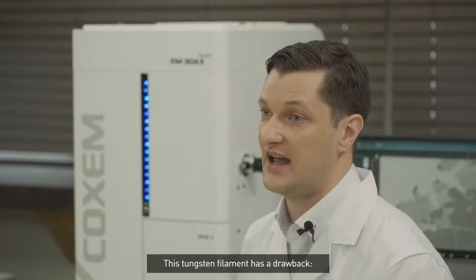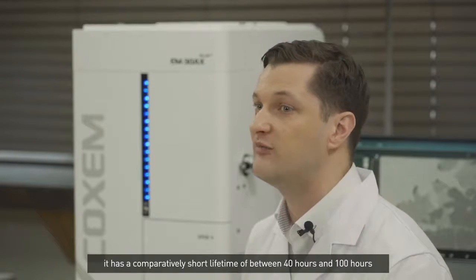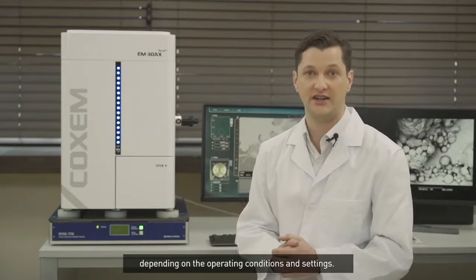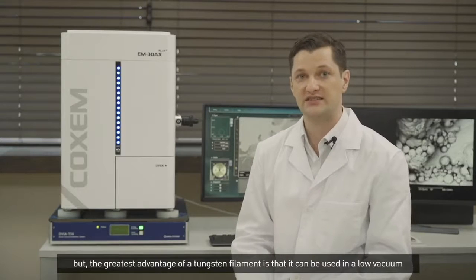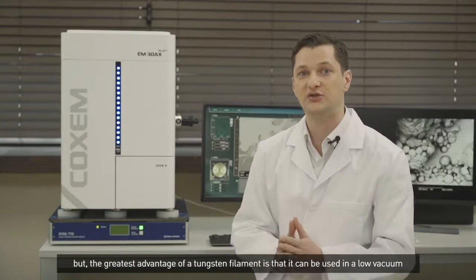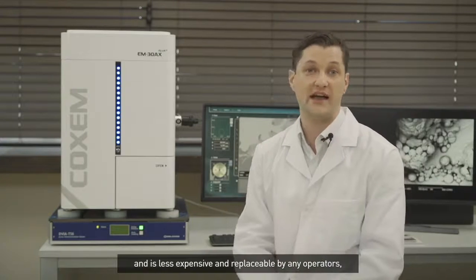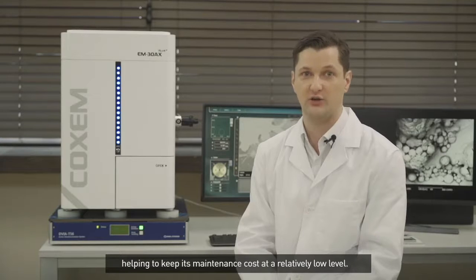This tungsten filament has a drawback. It has a comparatively short lifetime of between 40 hours and 100 hours, depending on the operating conditions and settings. But the great advantage of a tungsten filament is that it can be used in a low vacuum and is less expensive and replaceable by any operator, helping to keep its maintenance cost at a relatively low level.